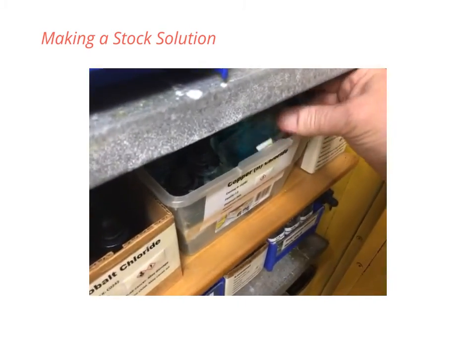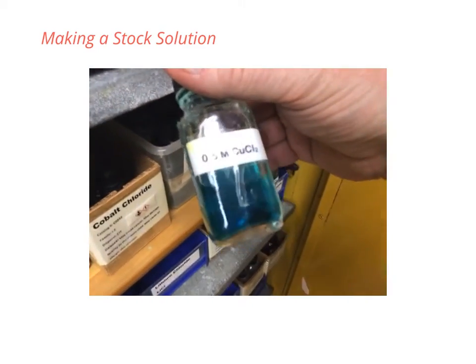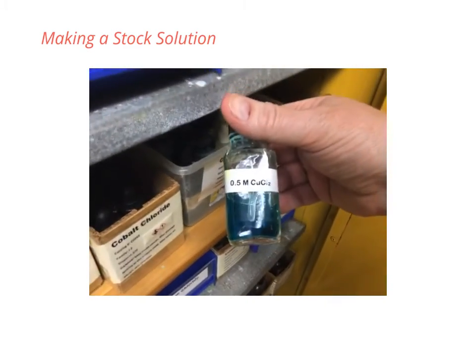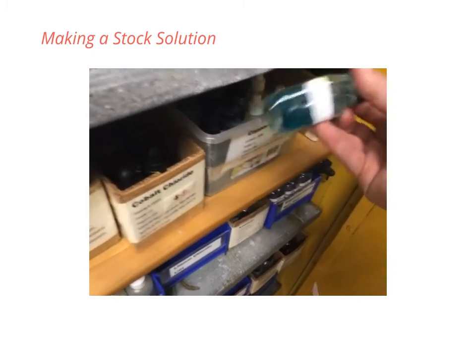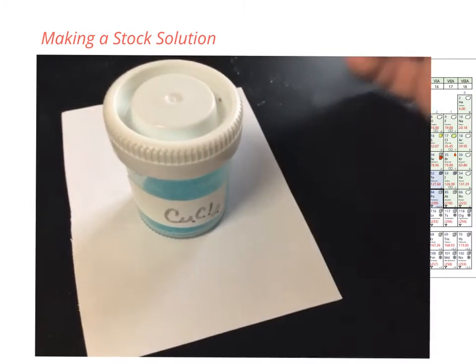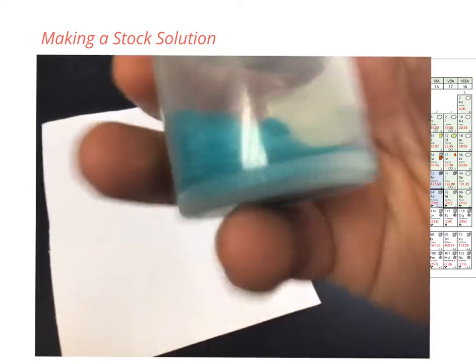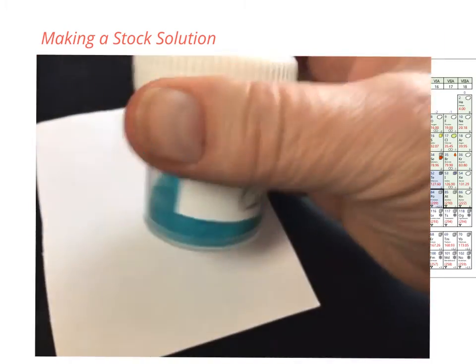Here we have some copper 2 chloride. We used that for a lab once before, 0.5 molar. Now, how do we make these particular solutions? Let's take a look. Let's say we want to make a 0.5 molar solution of copper 2 chloride. This is copper 2 chloride.